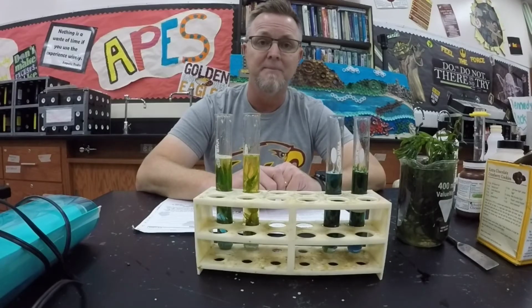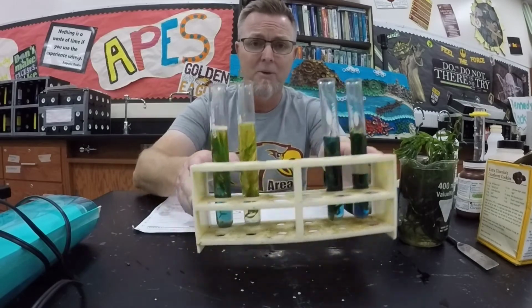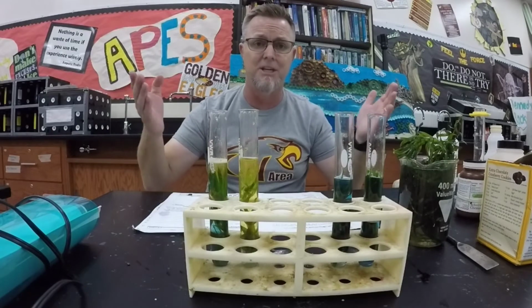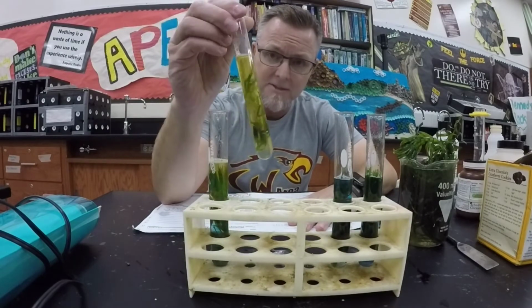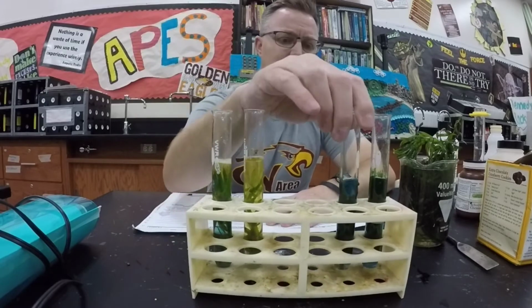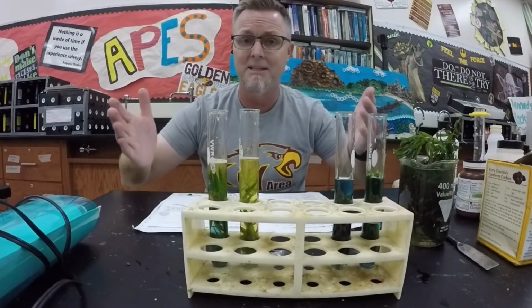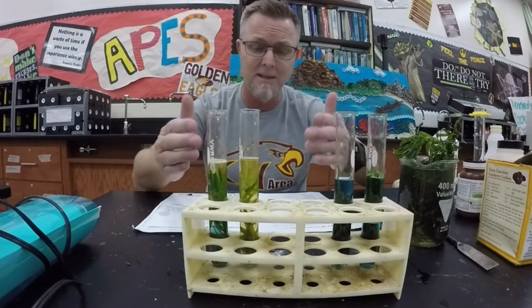1 hour later. I'm back. It's been about an hour, and whoa, there was a color change. Can you believe it? The test tubes that I left in the dark turned yellow, and the test tubes that I left out in the sun stayed blue. That's weird. How come these reacted, but those didn't? Or maybe did they both react? Am I missing something? You tell me.